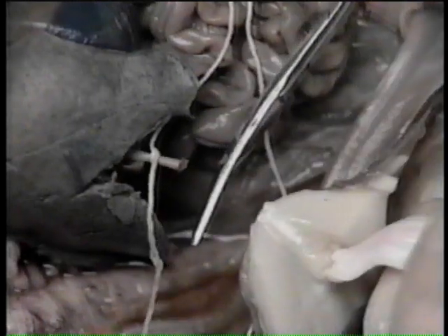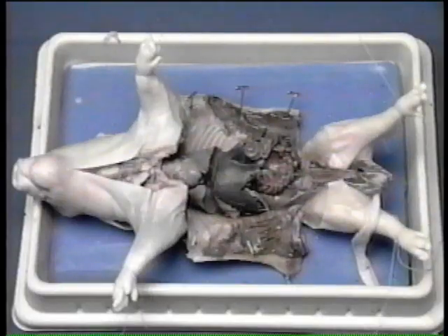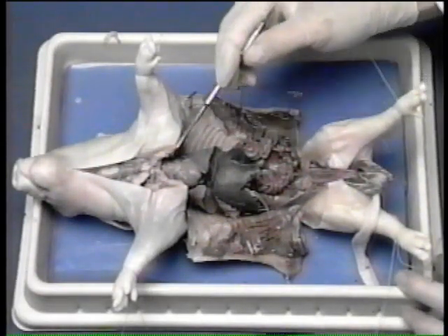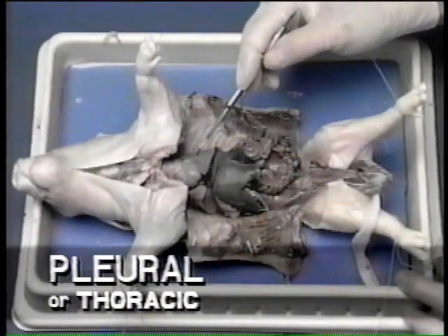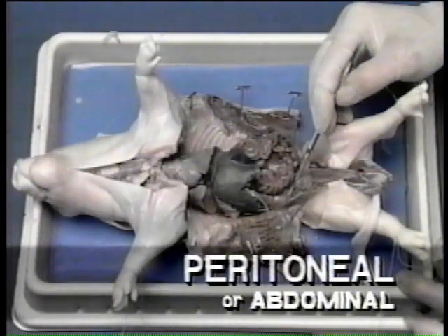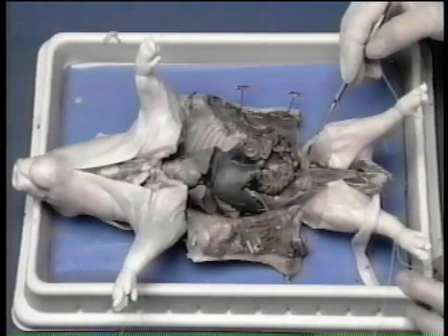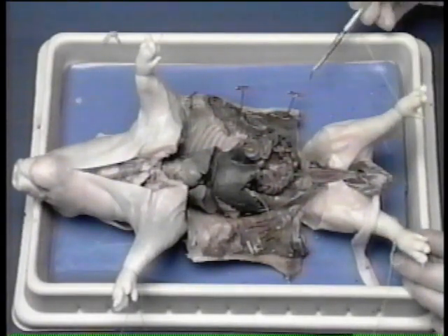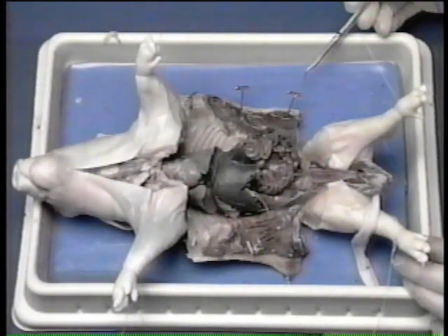Cut through the vein between the strings. The umbilical cord and its attached strip of flesh can now be pulled back. The two major body cavities are the pleural or thoracic and the peritoneal or abdominal. In the following section, make only general observations, concentrating on size, color, and the relative positions of the organs.